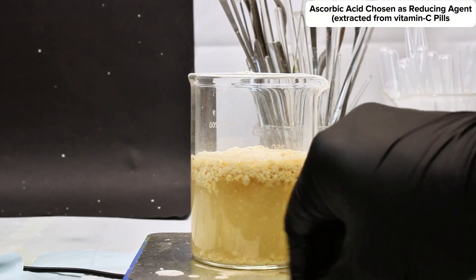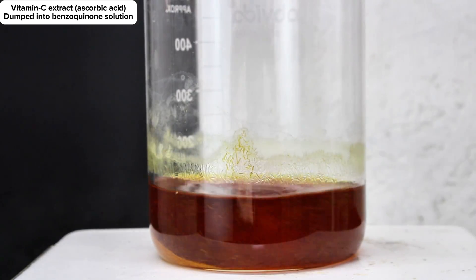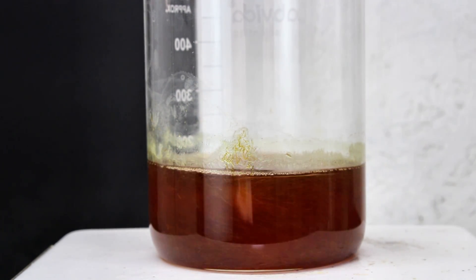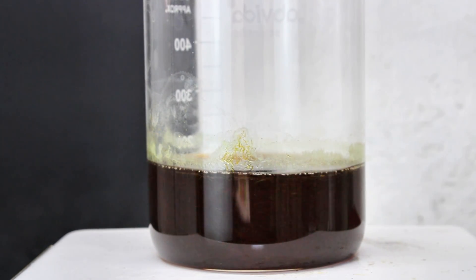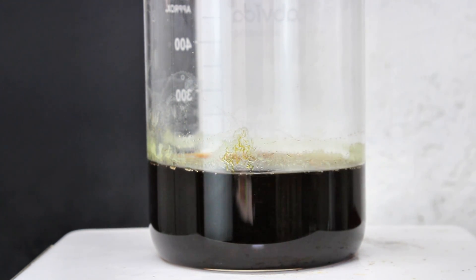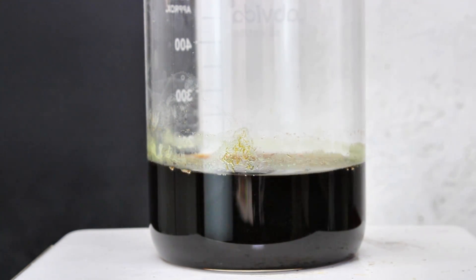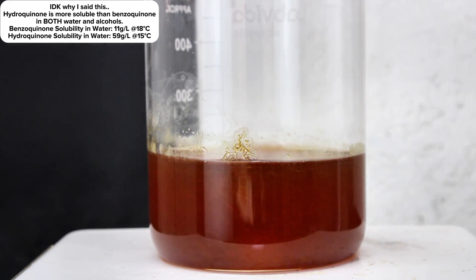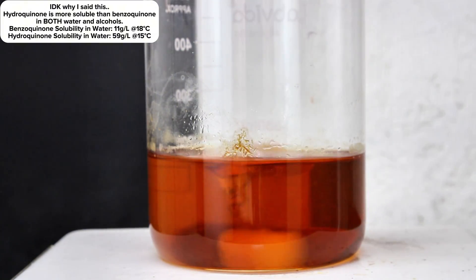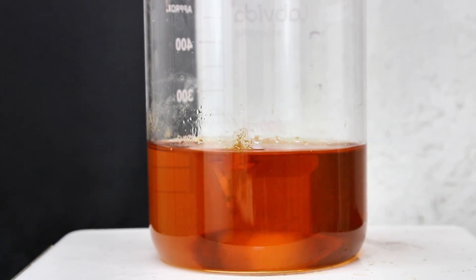After a bit of stirring, the mixture was passed through a coffee filter to remove the pill binder material, leaving me with an at least somewhat reasonably pure solution of ascorbic acid. This was simply dumped into my benzoquinone solution without any further processing, which immediately resulted in an intense darkening along with some noticeable bubbling. This darkening was almost certainly the result of the charge transfer complex between the benzoquinone and hydroquinone, and given that it looked strikingly similar to the filtrate from my earlier recrystallization, I have something of a suspicion that my earlier filtrate may have contained a large amount of hydroquinone. The solution eventually lightened up a lot, as the last of the benzoquinone was reduced to hydroquinone.